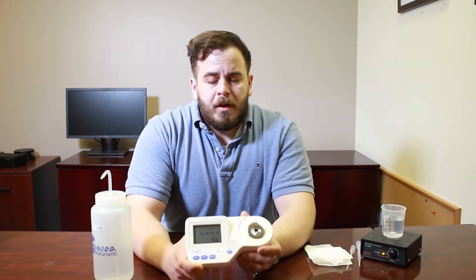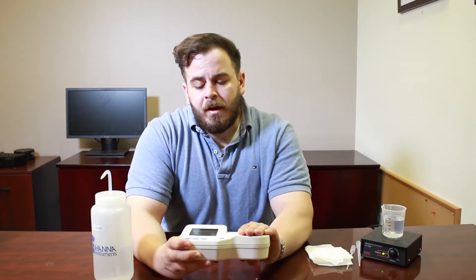If you look at the screen, you can see there's a temperature reading displayed along with the salinity value. It's a great device because you can calibrate it simply with RODI water — no special solutions needed, just DI, RODI, or distilled water. It also measures the sample temperature directly on the plate. If I put my hand on that plate, you can actually see the sample temperature rise because it's reading the warmth of my hand, and it will compensate for any temperature differences in the salinity value.